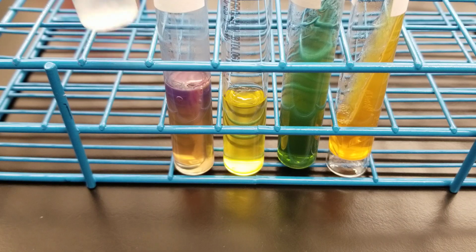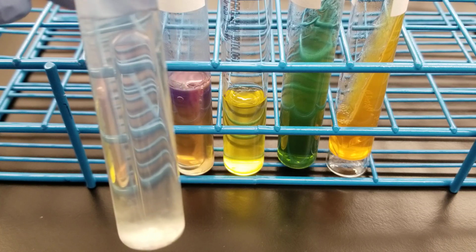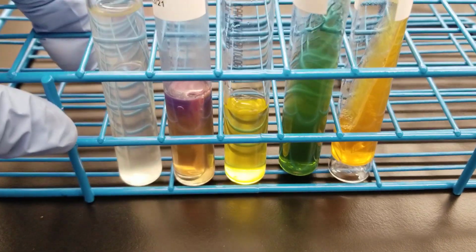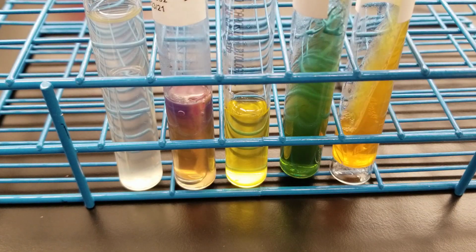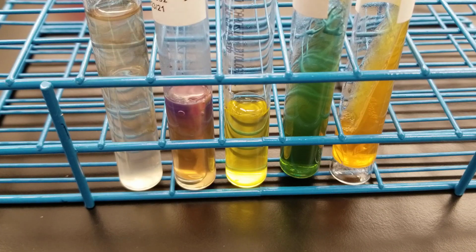Now let's do our nitrate reduction tube. All of the Enterobacteriaceae should be positive, so we're hoping that's going to be the case. There are no bubbles in the Durham tube, the upside down little test tube in there. So I'm going to add my reagent A again. So we're going to do those 5 drops of A. A is the darker one. Okay, I've just been keeping some of it in my pipette there, so we'll do 5. 1, 2, 3, 4, 5, and it's followed directly by reagent B, 5 of those.